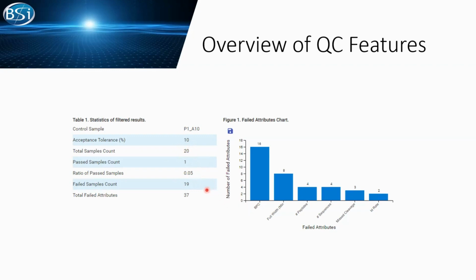How many samples have at least one failed attribute is listed, and the total number of the failed attributes is also listed. And on the side, we provide a bar chart to give you an idea about what your failed attributes are in all your samples. So in here, we give you an overview about how your samples behave, a quick answer about whether your sample passed or not.